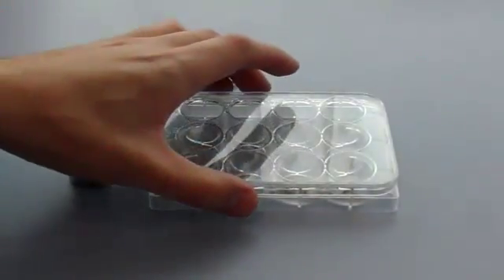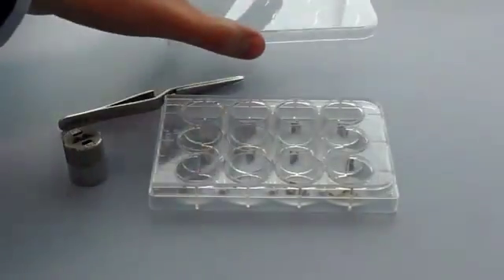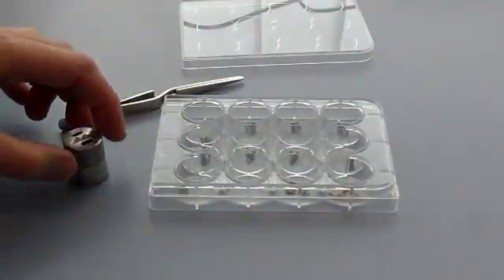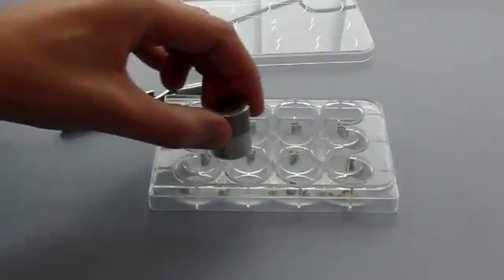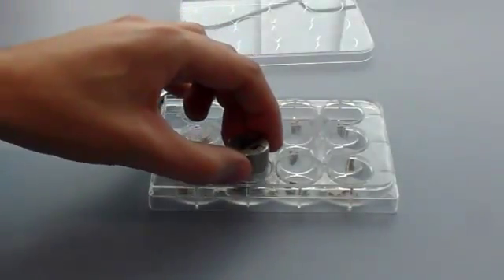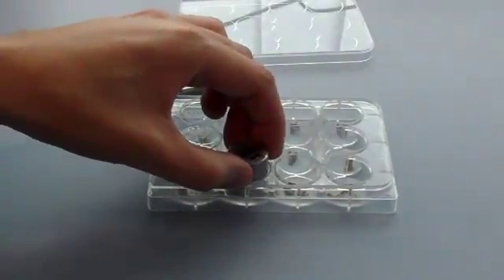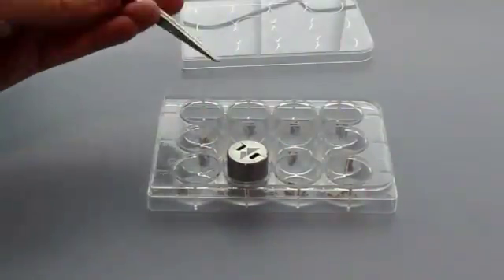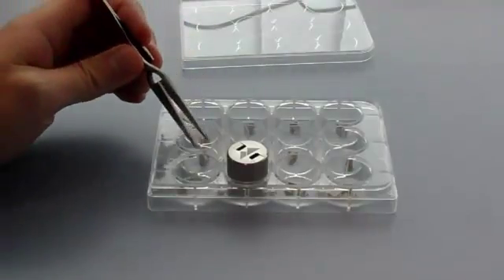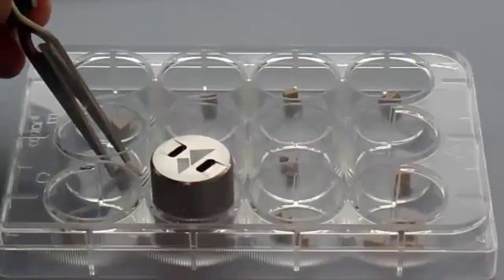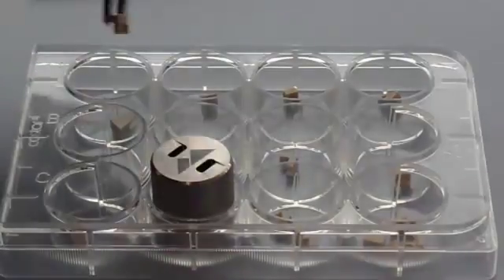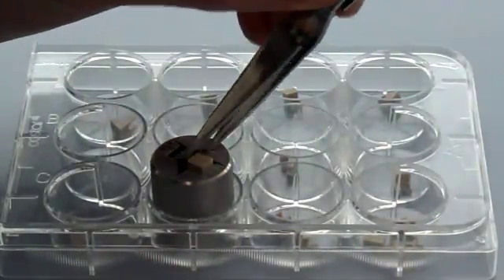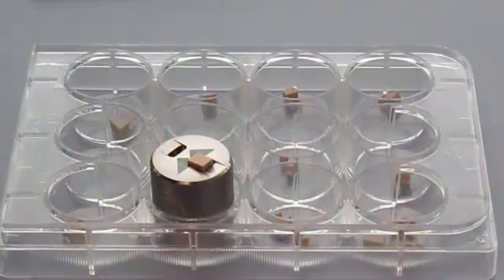Measurements on the surface zeta potential cell begin with the preparation of the sample. The sample holder gluing tool can be placed in a well of the 12-well plates containing the sample holders. A sample holder is placed on top of the tool. Two samples can be prepared at the same time.